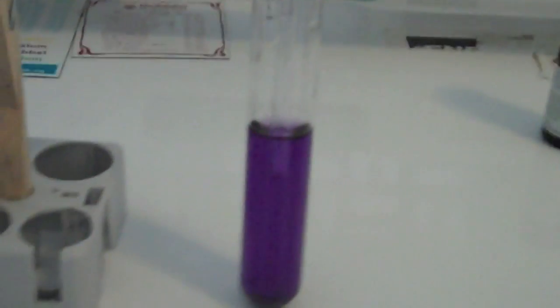As you can see there is condensed water vapor on the sides of the test tube. Water vapor is a byproduct of sodium hydrogen carbonate decomposing into carbon dioxide, water, and sodium carbonate.